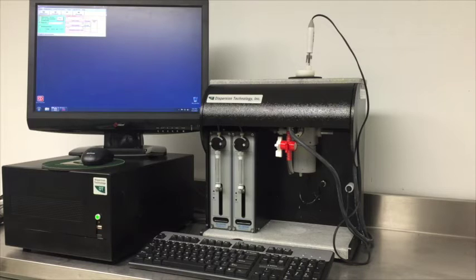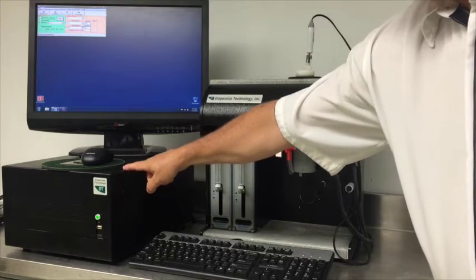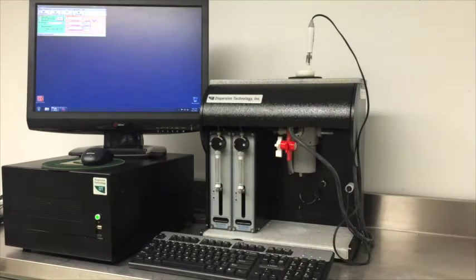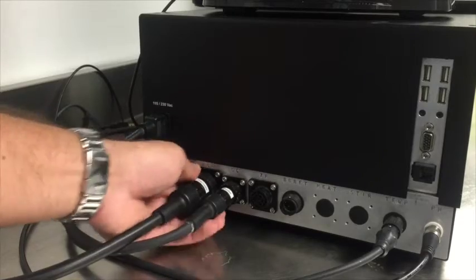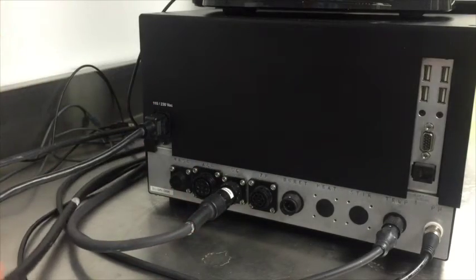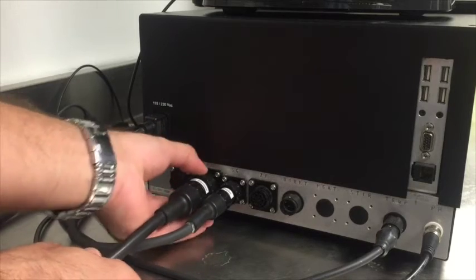What you are looking at now is the most general setup of the DT1202, which contains all options. This is our lab unit, which has been through years of use, so please disregard any wear or signs of aging. There is an electronics box that contains all electronic components, as well as the computer hardware and software used for conducting all of the measurements. The back panel of the electronics box has a set of outlets for connecting the cables of various probes that are placed into the measuring unit stand. Each outlet and cable are unique, which eliminates the possibility of plugging the wrong cable into the wrong outlet.